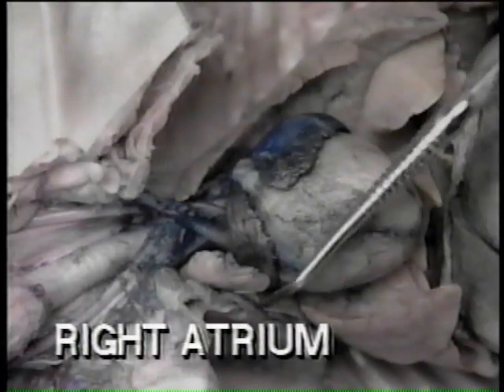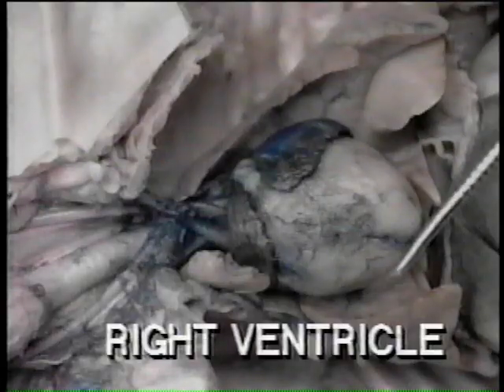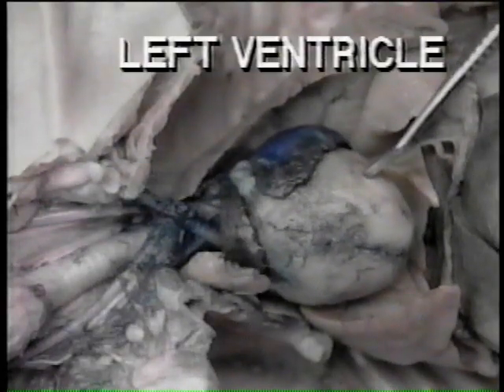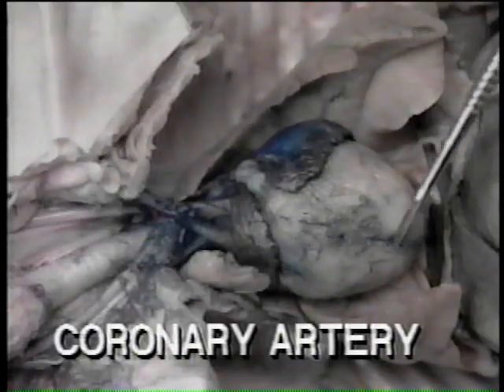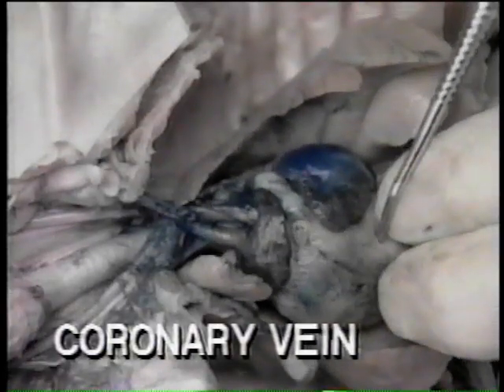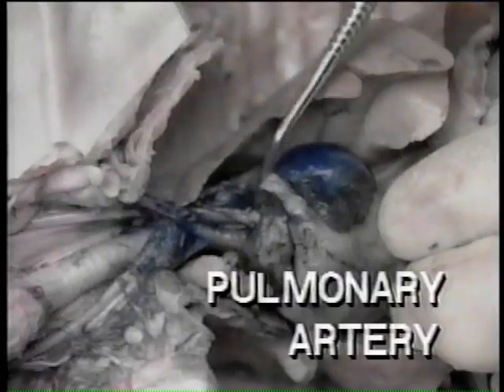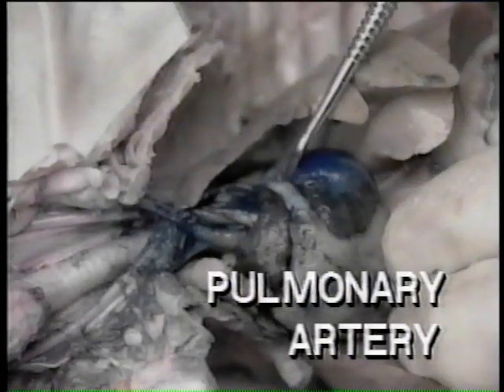Identify the heart's 4 chambers: the thin-walled right atrium and left atrium, the thick-walled right ventricle and left ventricle. The coronary artery and coronary vein lie in a diagonal groove between the ventricles. The large vessel leading from the right ventricle is the pulmonary artery, which in the adult pig carries blood to the lungs to be oxygenated.